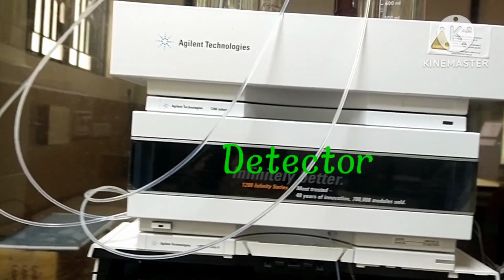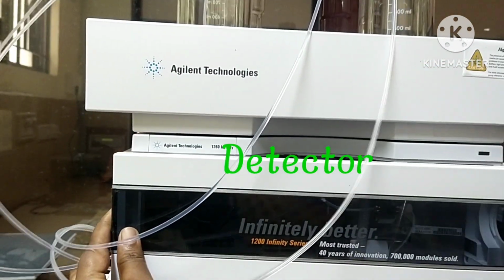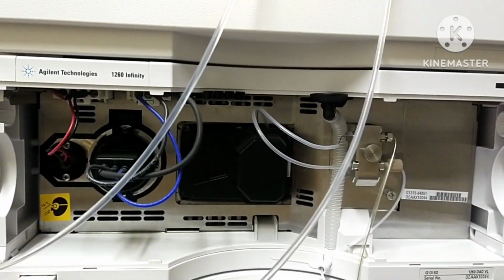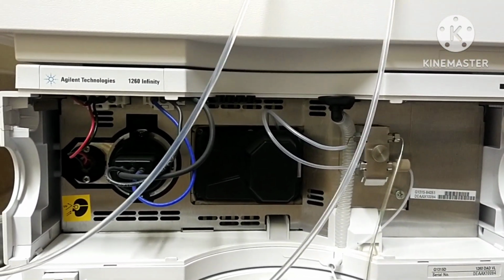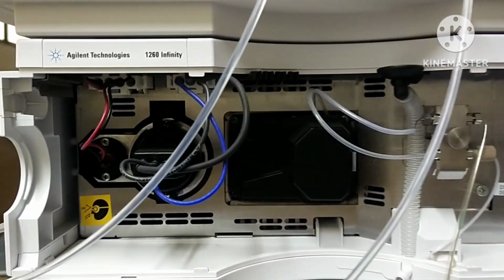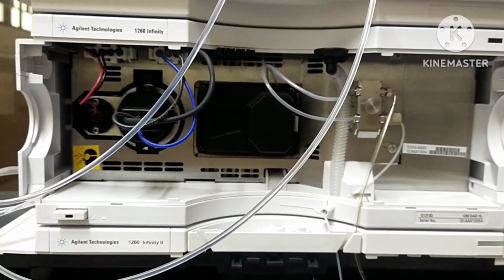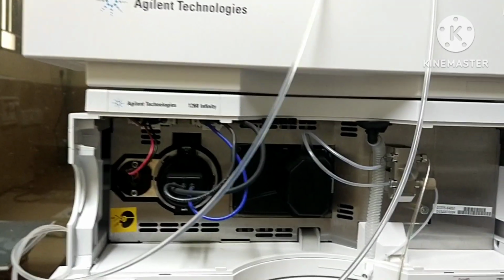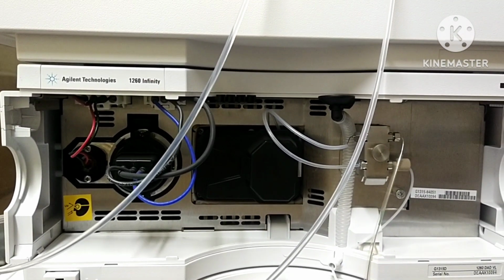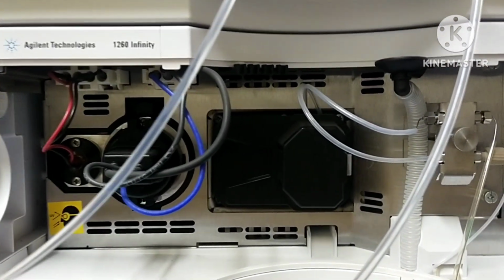It is the detector. Separation of analytes is performed inside the column, whereas the detector is used to observe the obtained separation. The composition of the eluent is consistent when no analyte is present, while the presence of analyte changes the composition of the eluent. Hence, the detector measures these differences. This difference is monitored as an electrical signal. A common HPLC detector is the absorbance detector, such as ultraviolet absorption detectors and photodiode array detectors. Here, a diode array or variable wavelength detector is used.